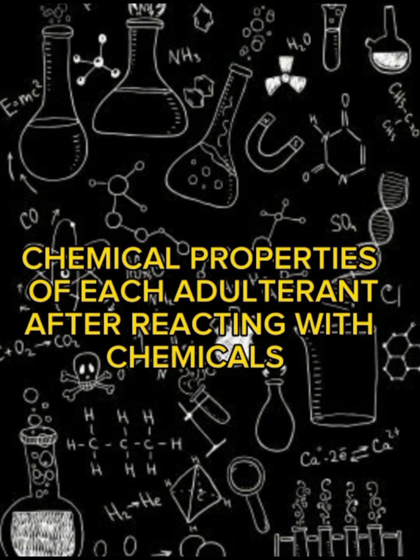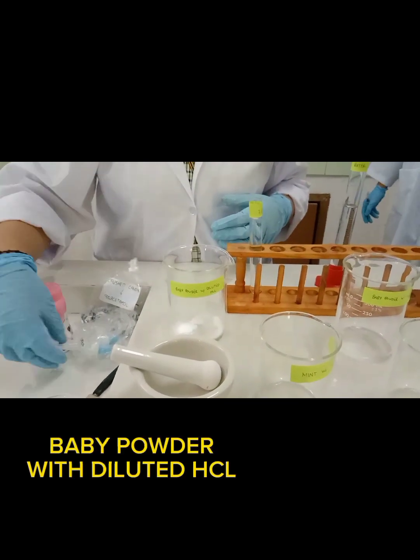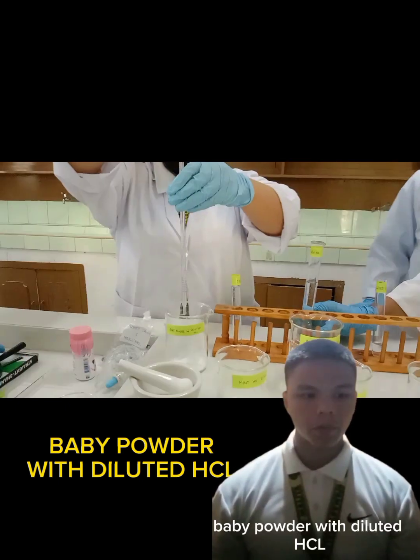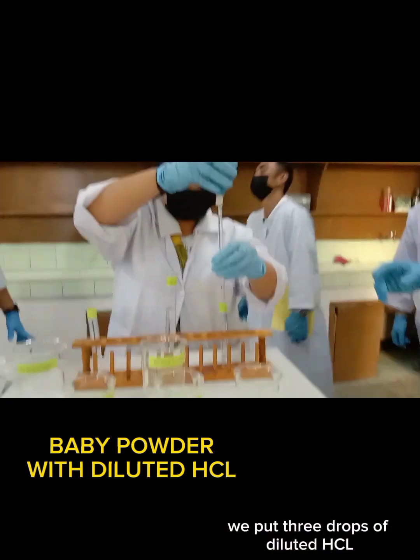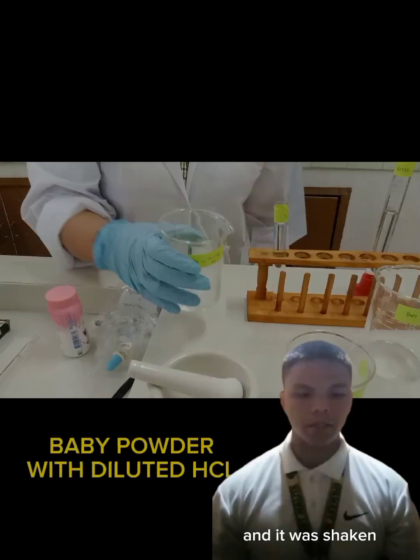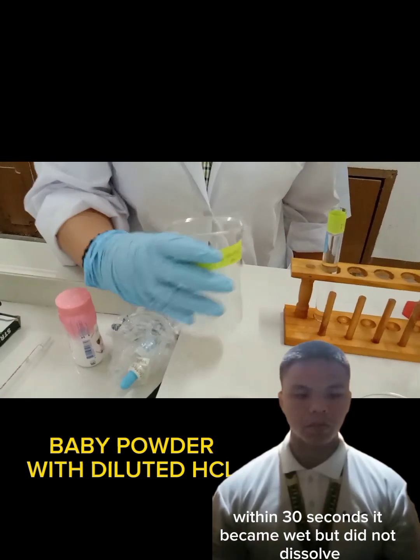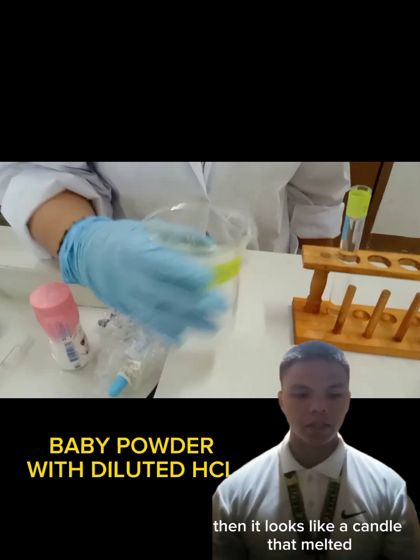Chemical properties of each adulterant after reacting with chemicals. Baby powder with diluted HCl. We put 3 drops of diluted HCl and it was shaken within 30 seconds. It became wet but did not dissolve. Then it solidified and also had bubbles. Then it looks like a candle that melted.